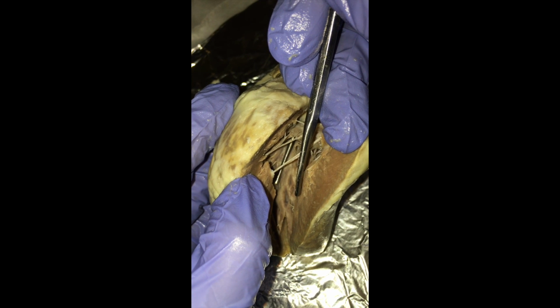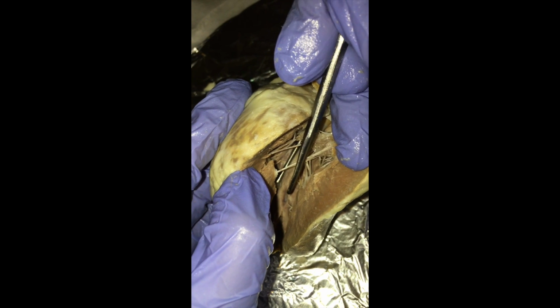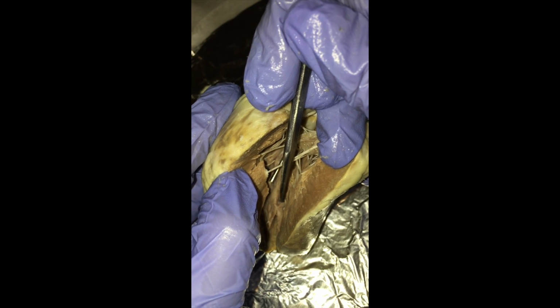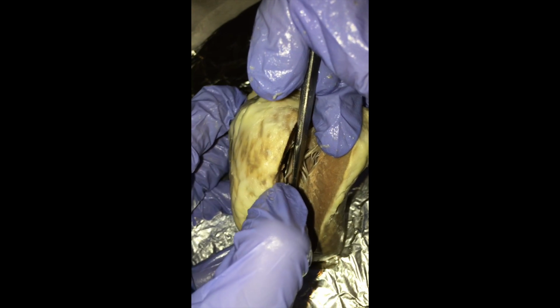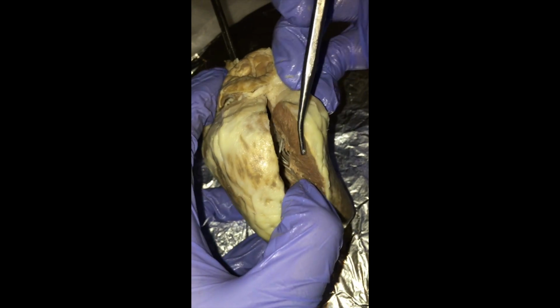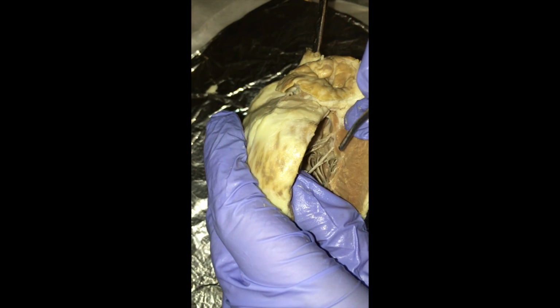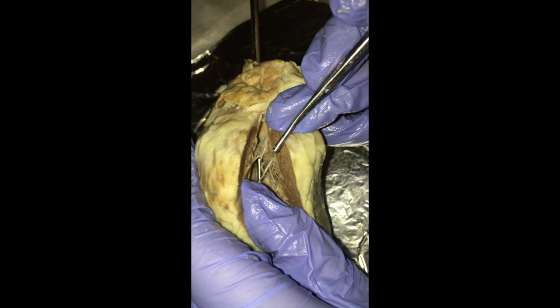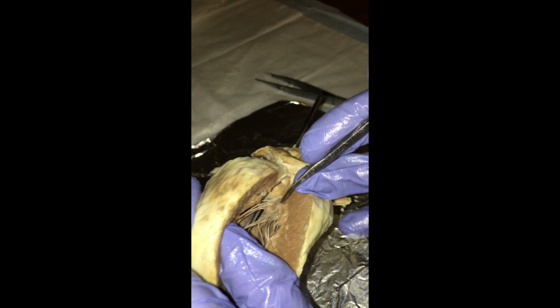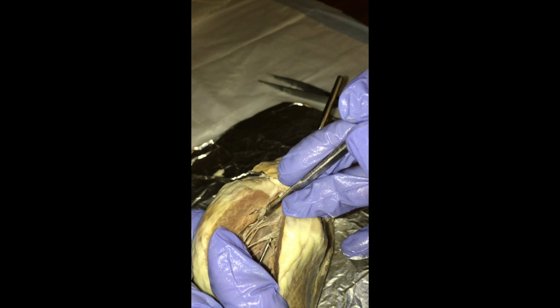So now I'm going to point out the trabeculae carneae on the inner surface of the ventricles, which is this area right here. Next I'm going to be showing the interventricular septum, which are the cuts which were made. And that's found right along here. Next I'm going to talk about the bicuspid, which is this top area here. And then back here we have the tricuspid.